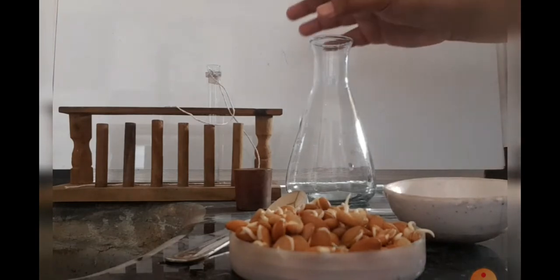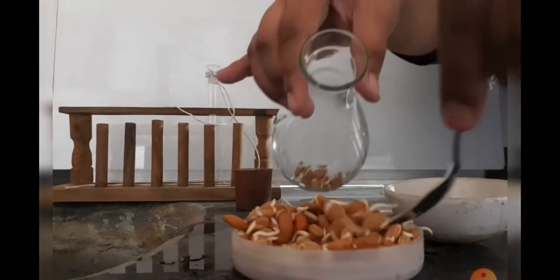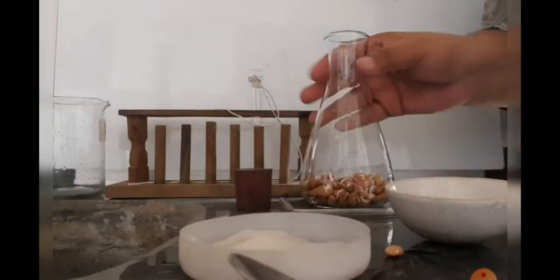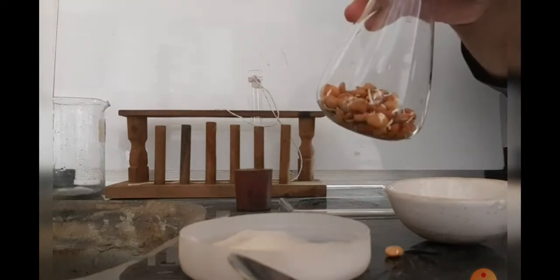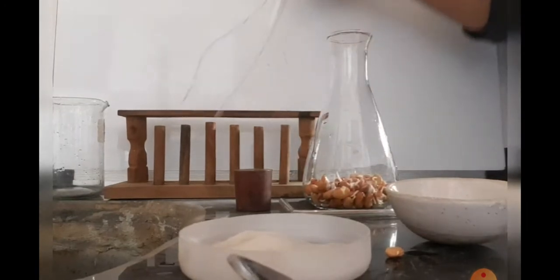We need to place these sprouted beans in a conical flask. Here we took a conical flask, and in this conical flask we are adding the sprouted beans. After placing the sprouted beans in the conical flask, the second step is to take pellets of potassium hydroxide in a test tube.